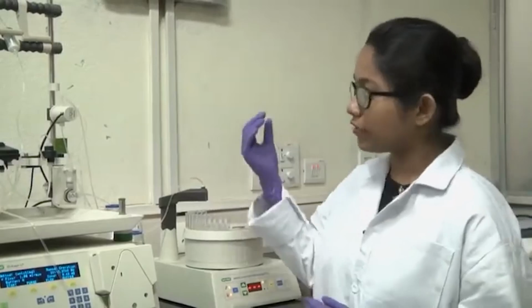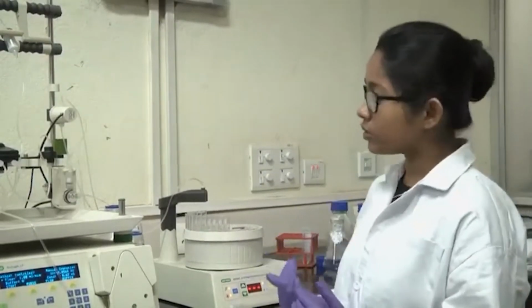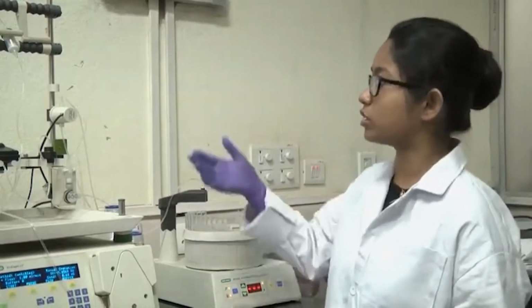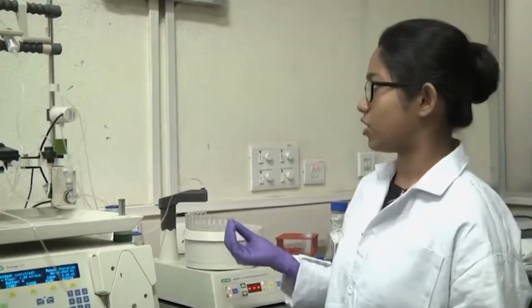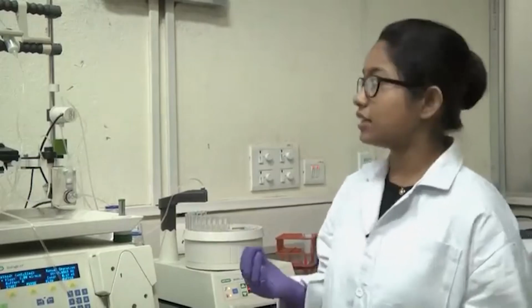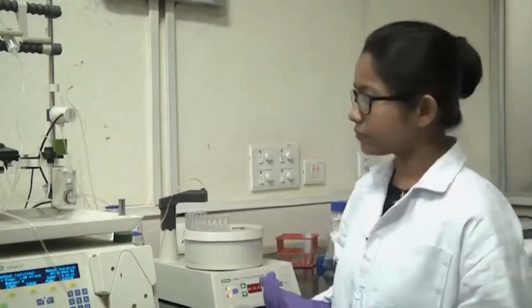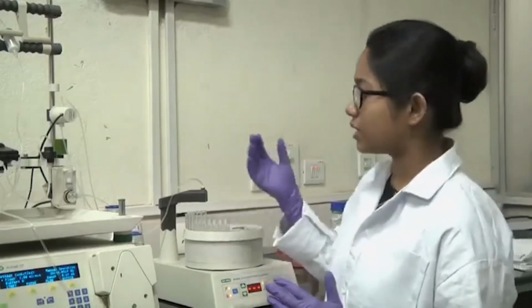Now, after you inject your protein, again you should run the wash buffer, and the wash buffer will direct your sample, or the solutions which have your protein of interest as well as other proteins which you do not want, towards the column. Your protein of interest will bind to the Ni-NTA column because it has a His tag, and the other proteins will come out from the column and go into the waste. And you have to monitor the whole thing by the UV lamp.